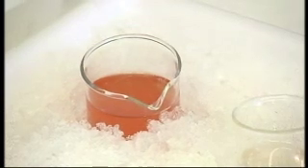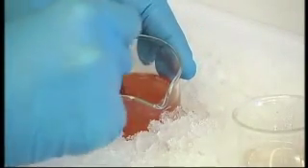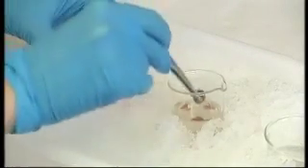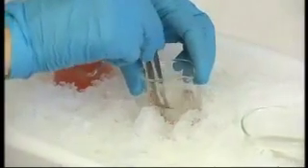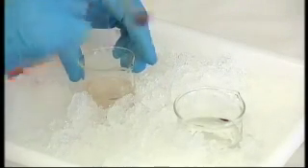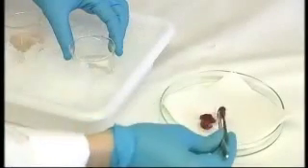Squeeze the heart to remove blood and put it into the second beaker. Repeat this operation for each heart. Rapid cooling and washing of removed hearts is essential to obtain standard preparation free of hemoglobin and erythrocytes.